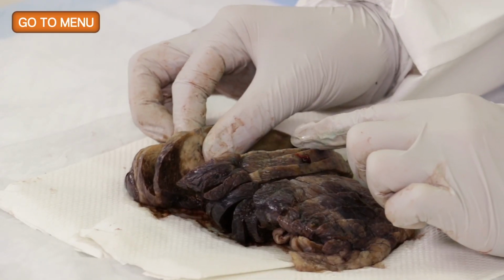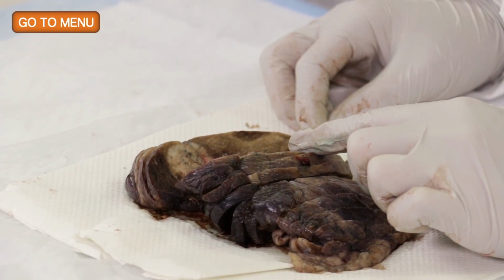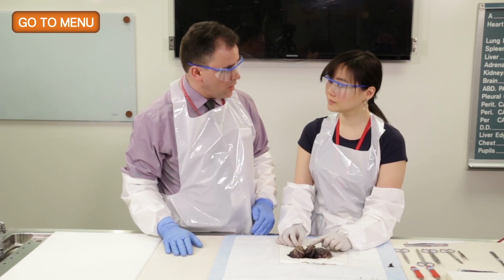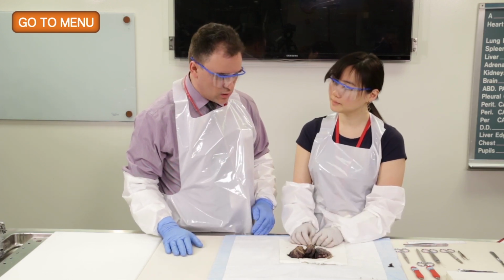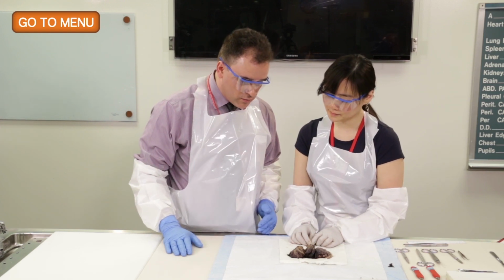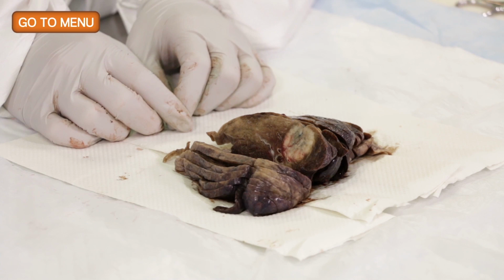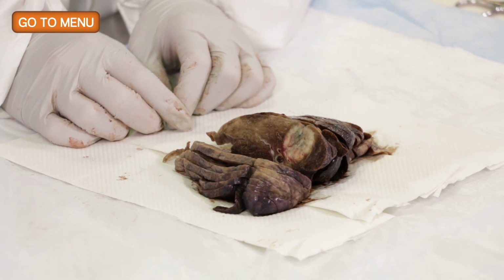No, definitely not. And this goes along with the clinical observation on CT scan that, in fact, this was a solid attenuation nodule on CT scan. One of the surprises at first in looking at it is that it doesn't look as spiculated or irregular as it did on the CT scan. Right. But perhaps a component of that had to do with the pleural pucker, and perhaps some of it is a little bit irregular as you look deeper towards the bronchovascular bundle.